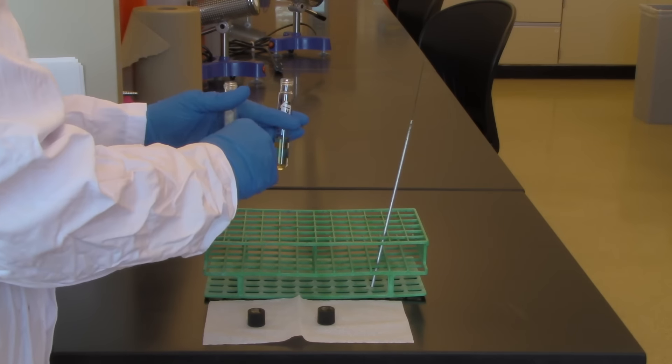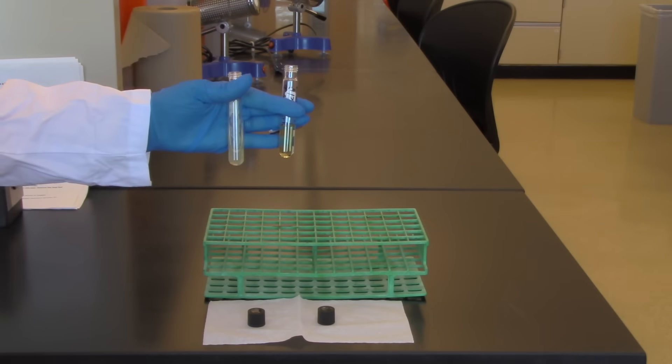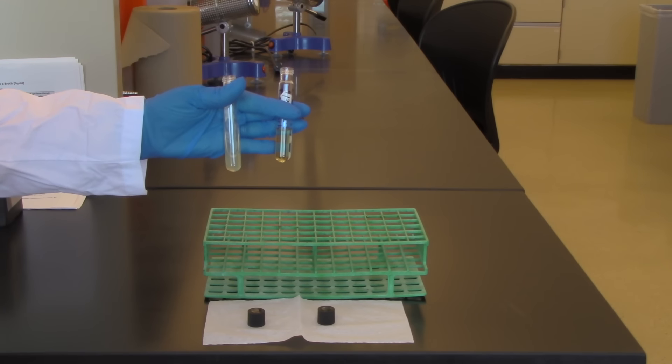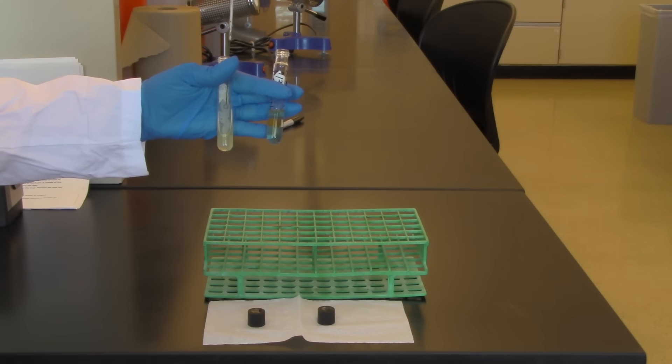Now I'm going to pick up my tool which has been sterilized and cooled and I'm just going to touch down into the slant. Make sure you touch. Do not dig into the agar. Just touch down. Remember you're picking up about the size of a freckle.